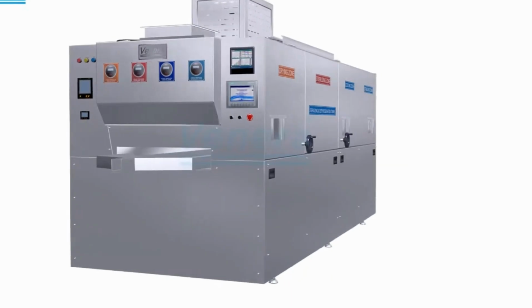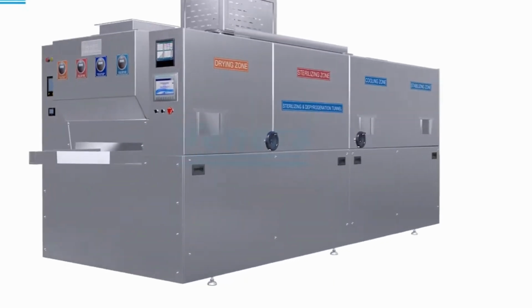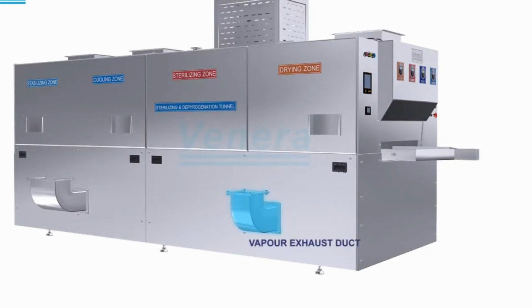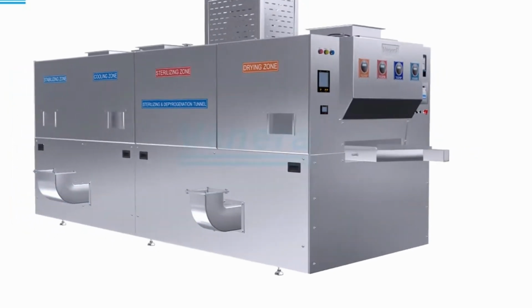Loading stage. Washed containers, vials and ampules, are loaded onto a conveyor belt system after going through a washing machine. The containers are typically made of glass and should be free of visible particles before entering the tunnel. The containers are evenly spaced on the conveyor belt to ensure uniform heating.